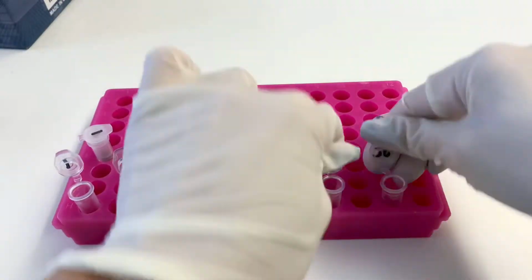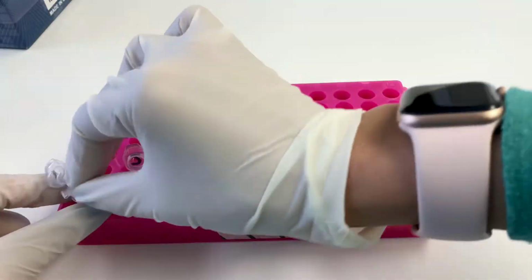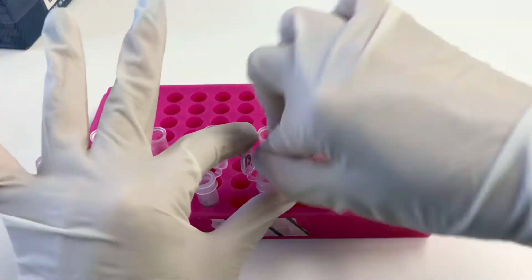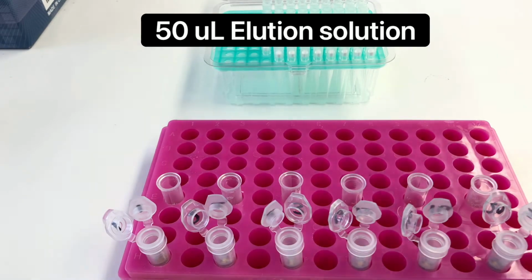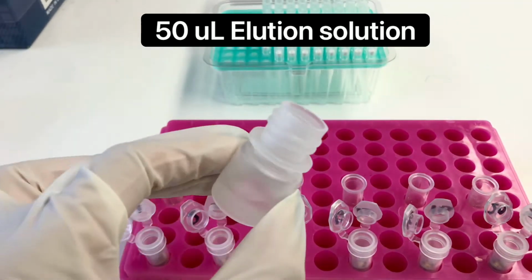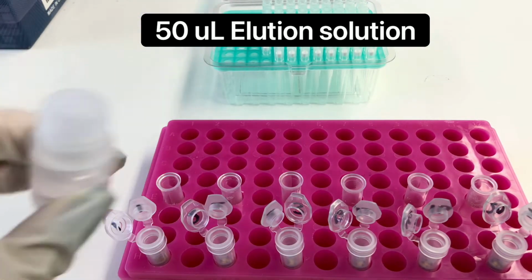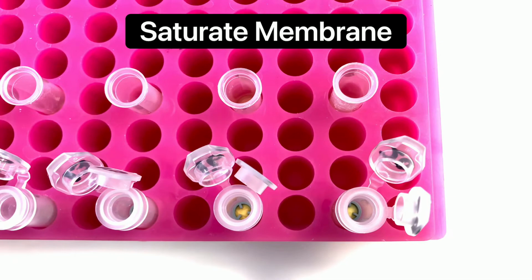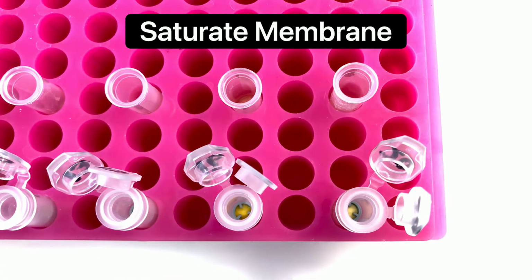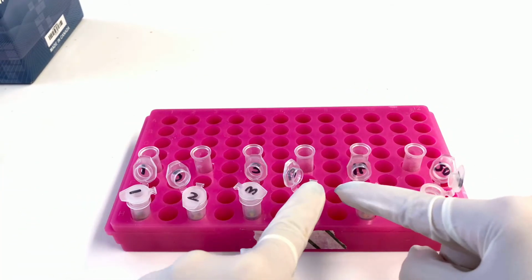Remove the spin columns and put them into a new tube. Open the spin column lids. Set a pipette to 50 microliters and add 50 microliters of the elution solution to the spin column. Be sure to saturate the membrane at the bottom of the spin column. Close your spin column lids.